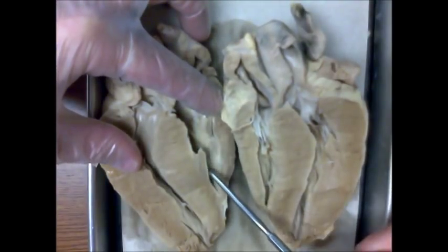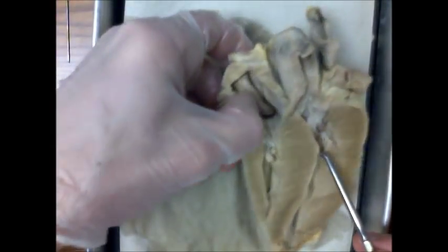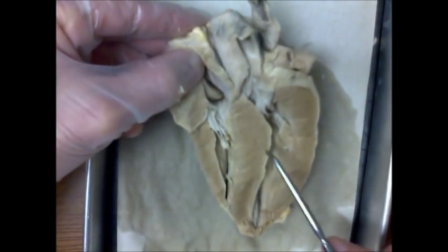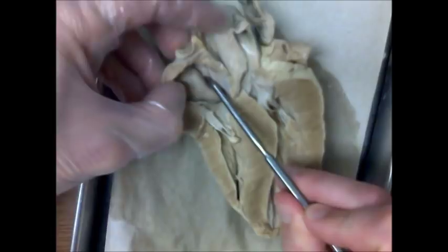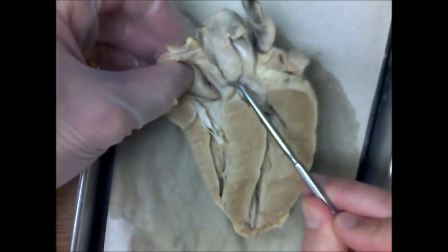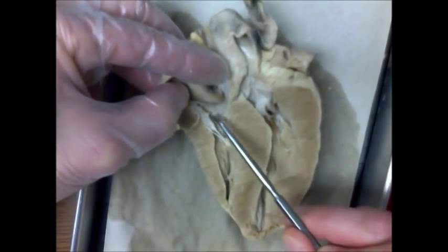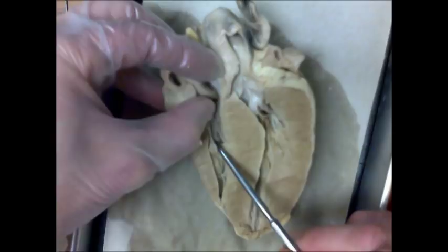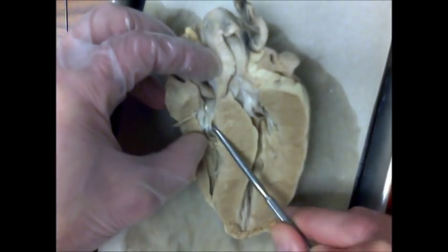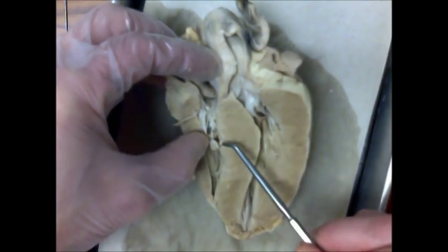Here we see the right ventricle chamber surrounded by its right ventricle myocardium, and this is the same chamber connected to this myocardium. Now that we've designated right ventricle and left ventricle, above the ventricles are the atria. Atria are receiving chambers and are relatively thin-walled. Between an atrium and a ventricle there is always an atrioventricular valve. On the right side of the heart, this AV or atrioventricular valve is known as the tricuspid. Atrioventricular valves can easily be found because they are attached to heart strings or chordae tendineae that prevent the valves from flipping back up into the atrium.